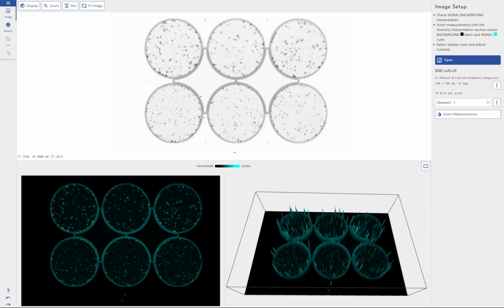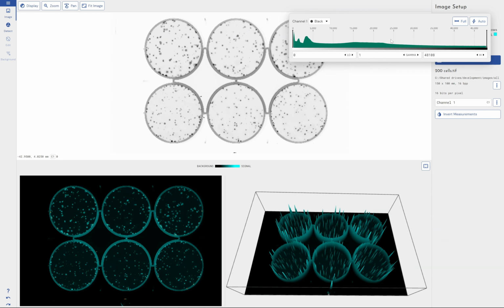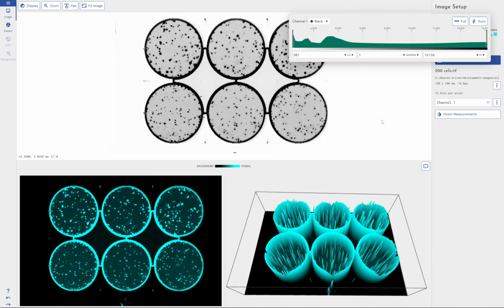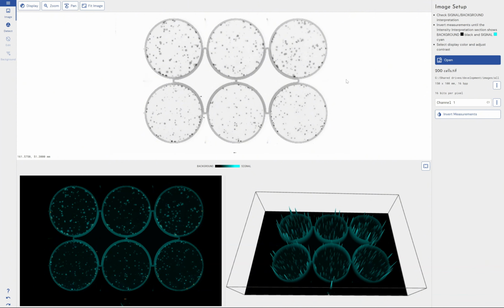So we see here, and if you've seen any of the other Phoretix image analysis software videos, you'll know what the setup is. So from here is where we control contrast and the display, and you can see how as I change these bits, the visibility of the image changes. It's worth noting that no matter what settings you apply here, the visualization doesn't change the results. So we're always taking the results from the raw, ideally TIFF image. This is purely a visual aid for the operator to be able to define areas of interest, define specific spots and things like that. So it's visibility for you.